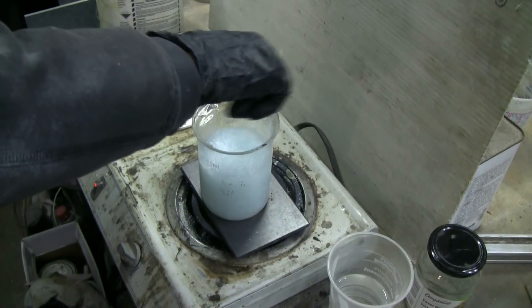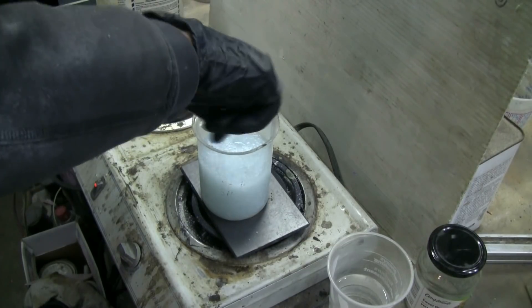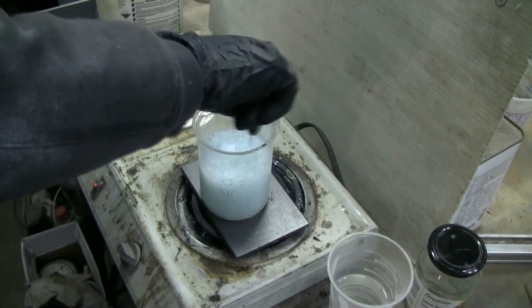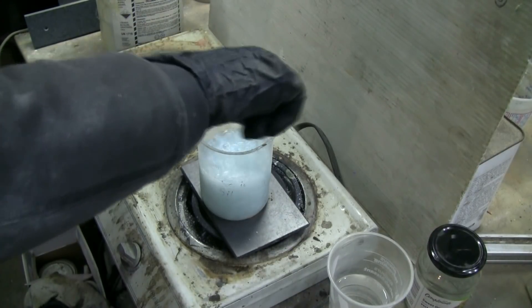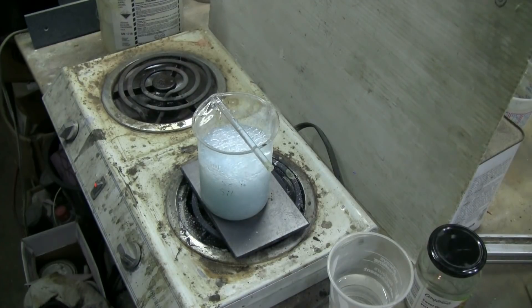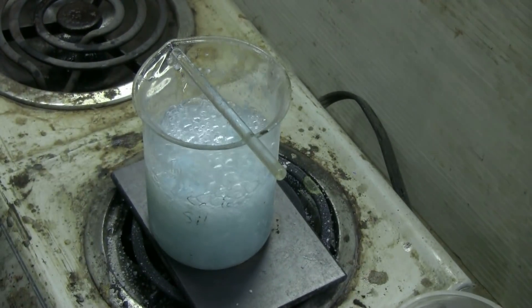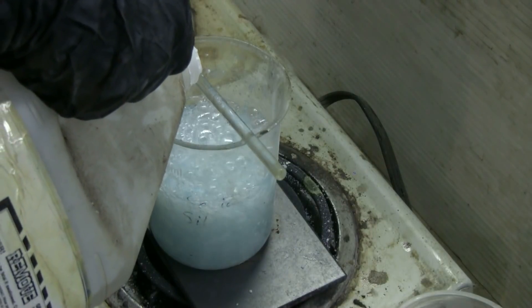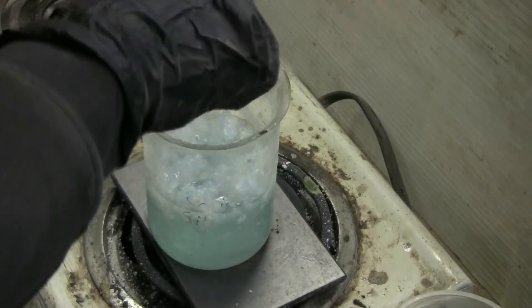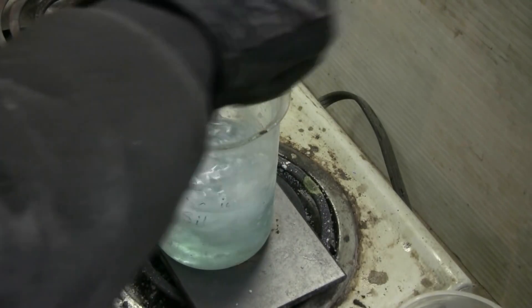Because cat litter crystals are fairly big you have to give the reaction time. I've never tried ball milling the silica gel down finer — I get sodium silicate quite nicely using it just the way it comes as cat litter right out of its bin. Half the crystals are dissolved already and it's getting much easier to stir. I'm adding a little more sodium hydroxide because I still have a little bit of unreacted silica gel.